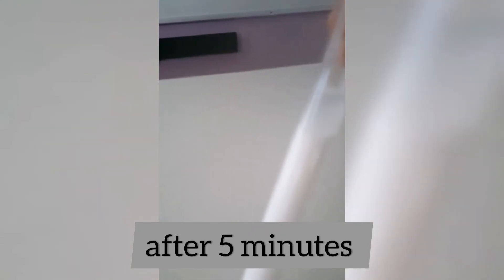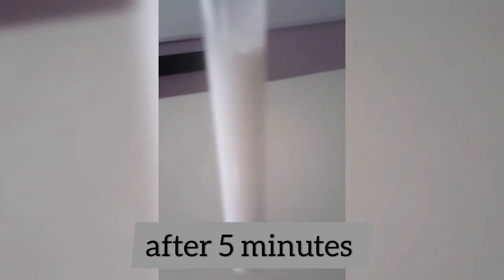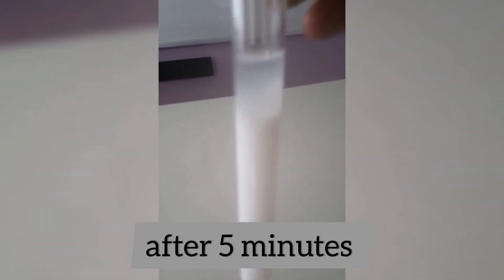I kept the solution for another 5 minutes to settle down. After 5 minutes I could see that the precipitated barium sulfate started settling down. You can see that in the water the solid residue has already started settling down.